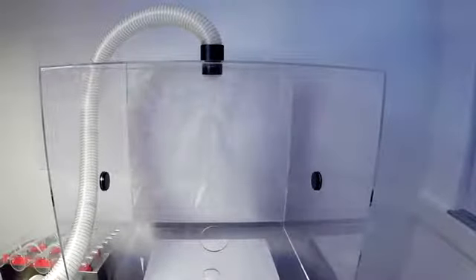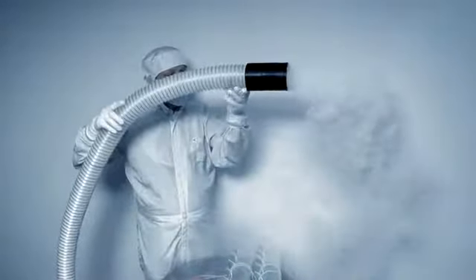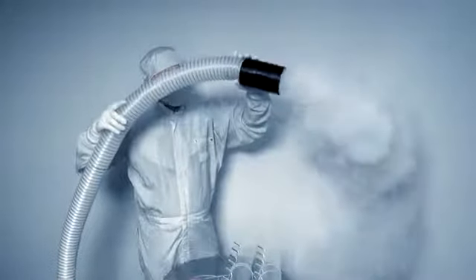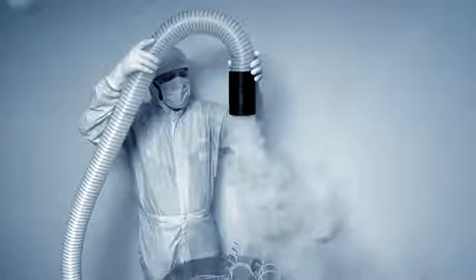If you test the airflow in five cleanrooms each quarter, four times a year for five years, the AP35 operating cost is $0.61 per cubic meter of fog produced. If your present fogger has only one half or one quarter the fog volume, fog density, and visual air flow distance, then the test time and operating costs increase by a factor of 8 to 20 for completing the same test.